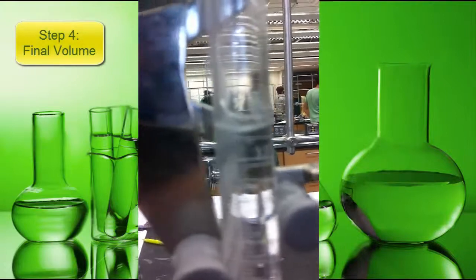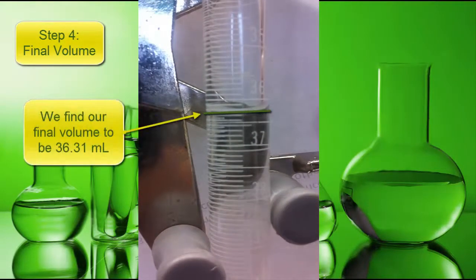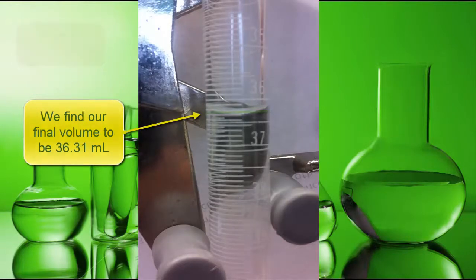Step 4: Final volume. We find our final volume to be 36.31 milliliters. Again, this is two decimal places.